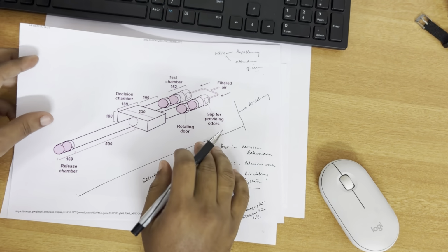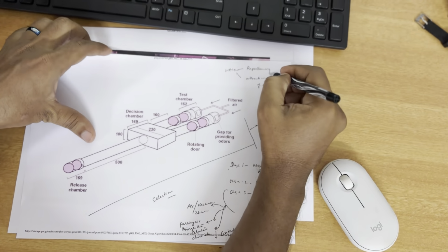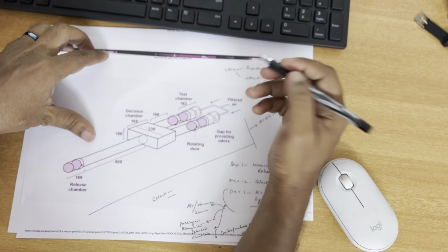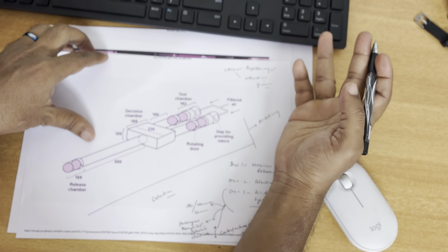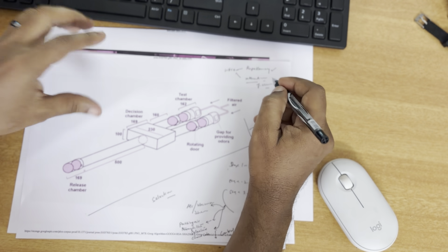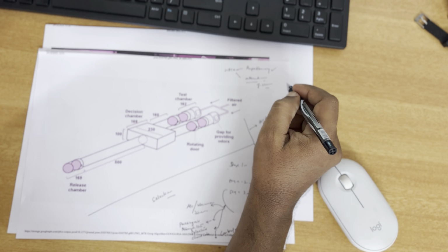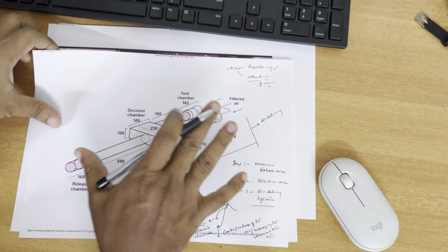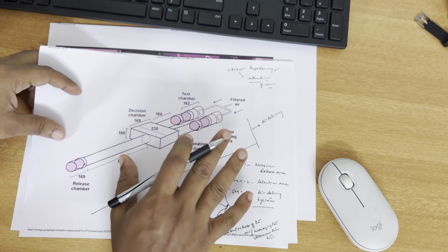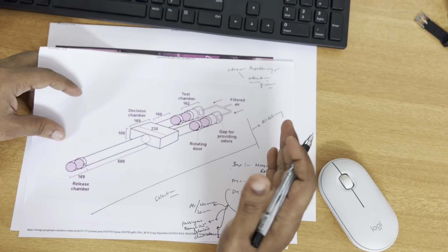Hello friends, today I will demonstrate the WHO olfactometer, which can be used both to study the repellence effect of an insecticide or of any chemical that you want to test, as well as to understand the attractive power of any individual, scent or chemical. The setup I'm going to show here can be used for both purposes. It can generate vacuum, and compressed air can also be sent to the system.